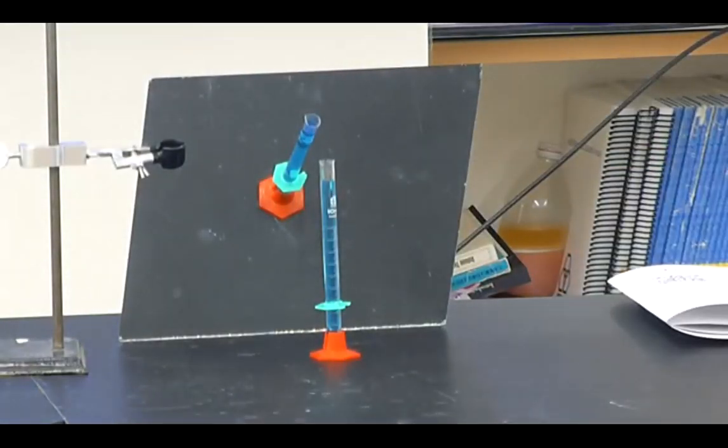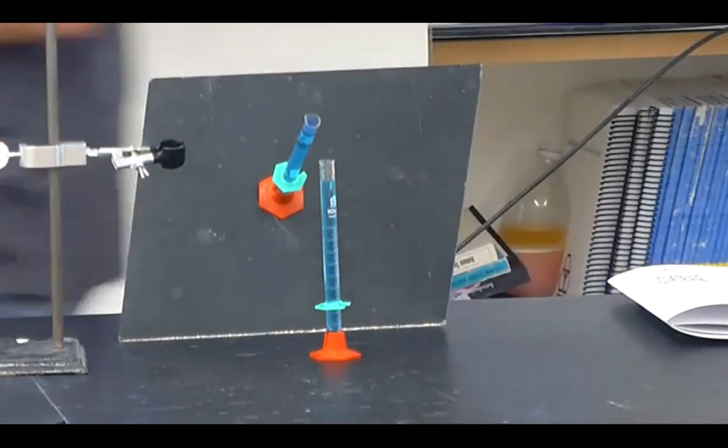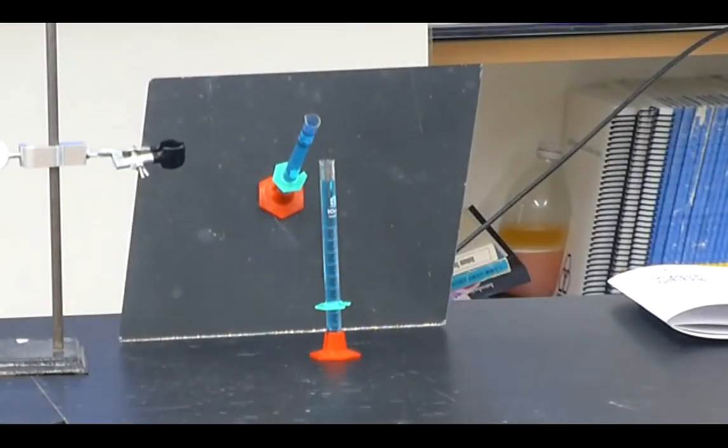All right, so it's just a normal paper clip, and this is just what we call copper 2 sulfate. So the paper clip is the iron. I filed it because they put plastic around it.